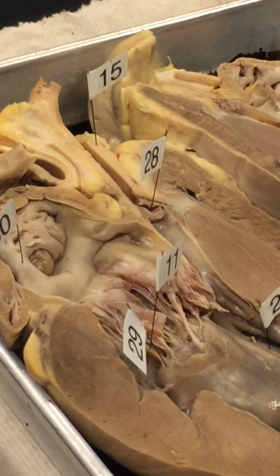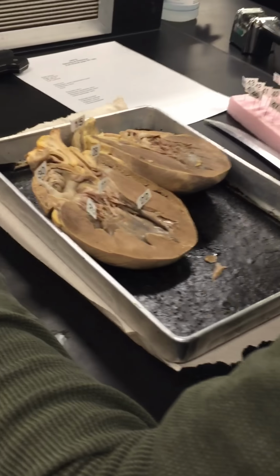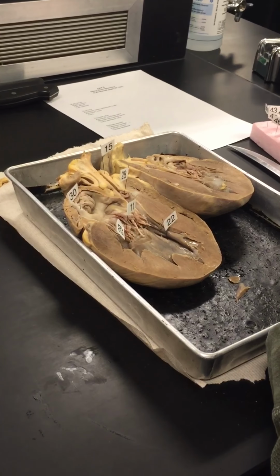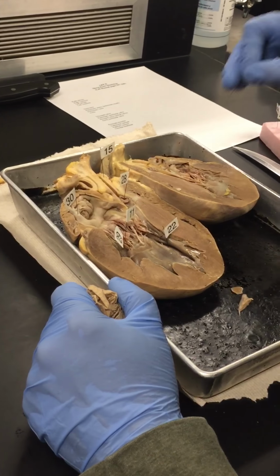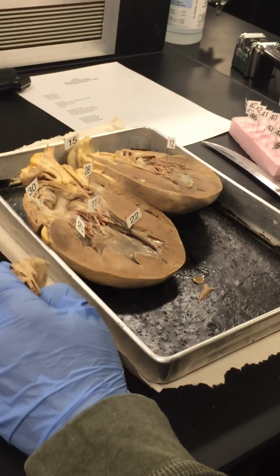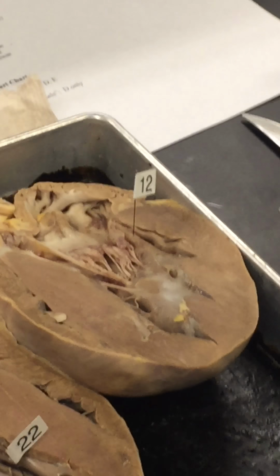28. And you can't see much on the right heart. Next time we slice one, we're going to go more through the right side. Okay, so this has got quite a few things on it. I'm going to put another pin on the other side here. Number 22, I'm going to put in 12. 12 is 22, same thing, trabeculae carneae.